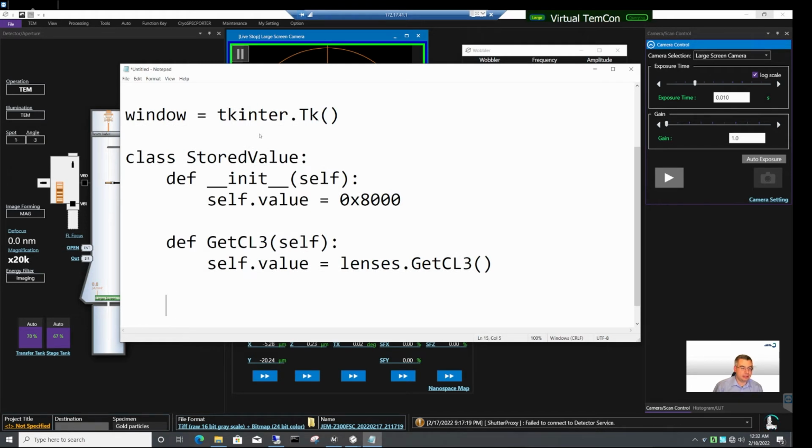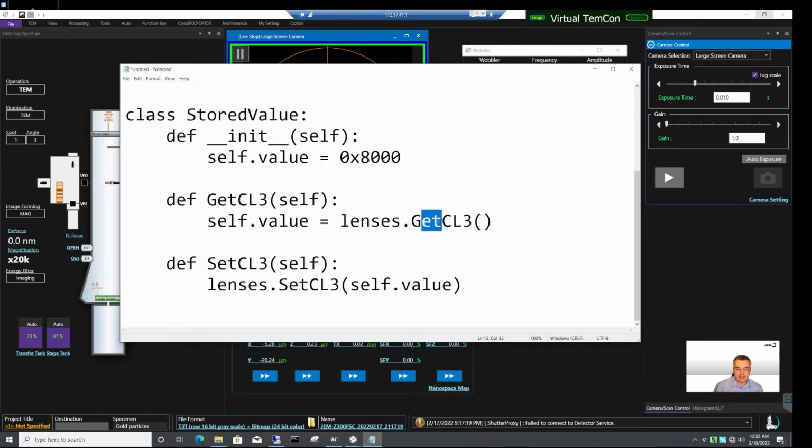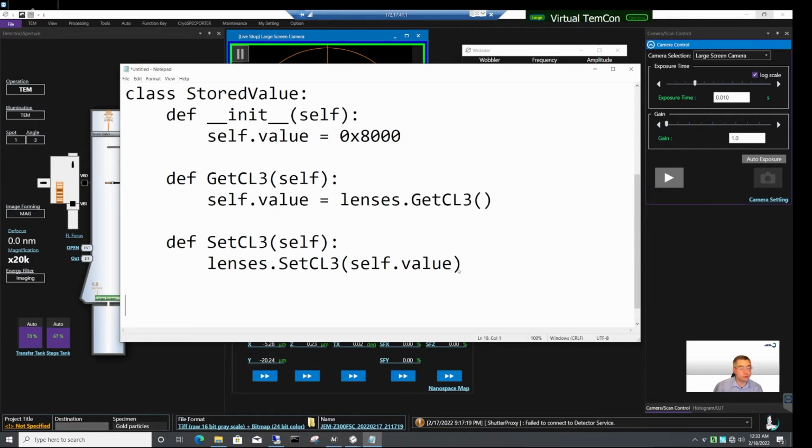And then similarly we need a method that will set CL3 value, and in this case this is lenses, so that's our object, setCL3 and then self.value. So you see, all this class does is either it captures CL3 or it sets CL3 value and then it stores it. This is all it does. The getCL3 and setCL3 methods of the lenses object are described in the PyJEM manual. So I encourage you to read the manual to understand exactly what these methods do and what sort of arguments they require.